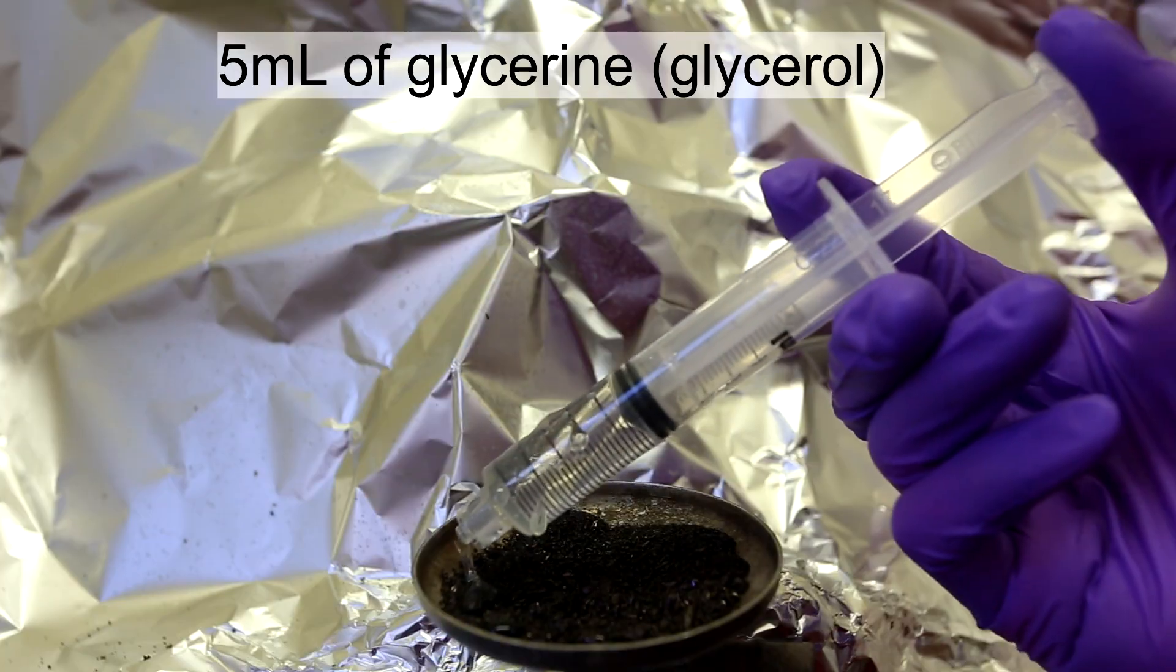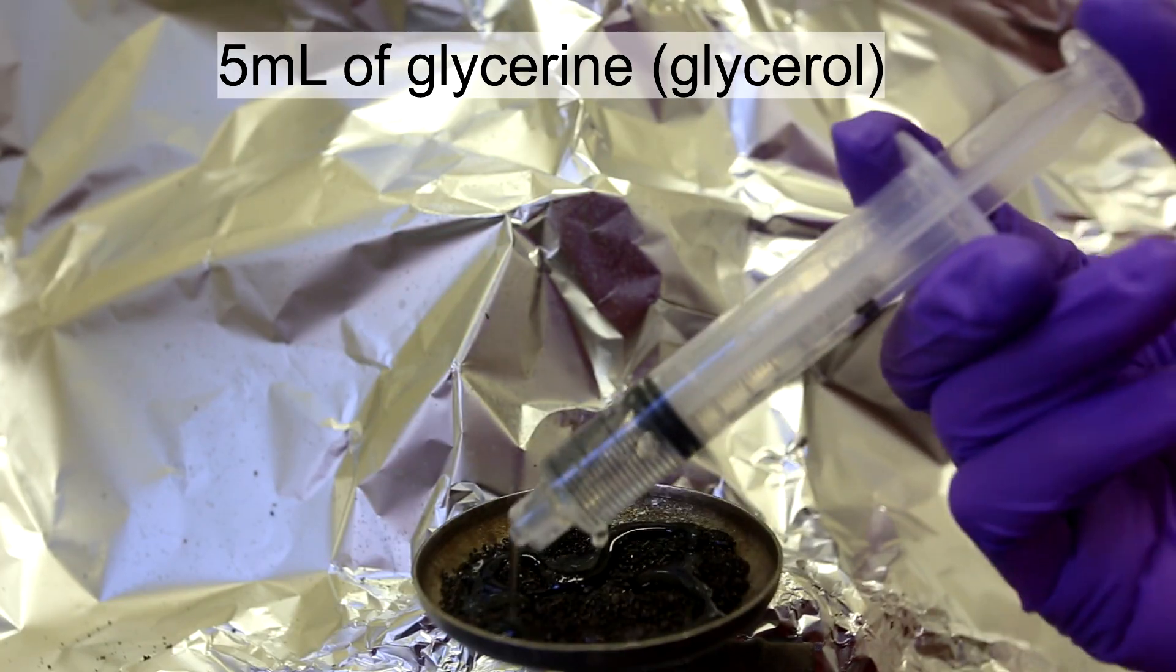Then, about 5 milliliters of glycerin was added. Glycerin also goes by the name glycerol.